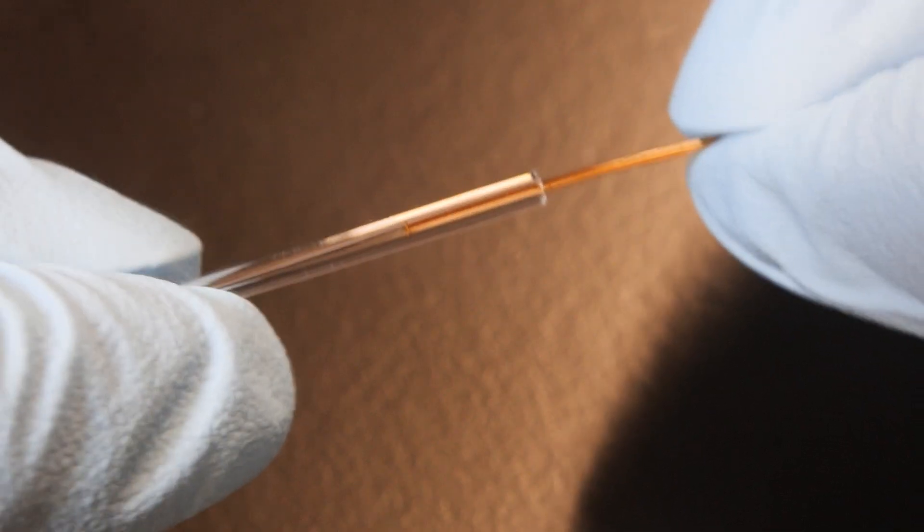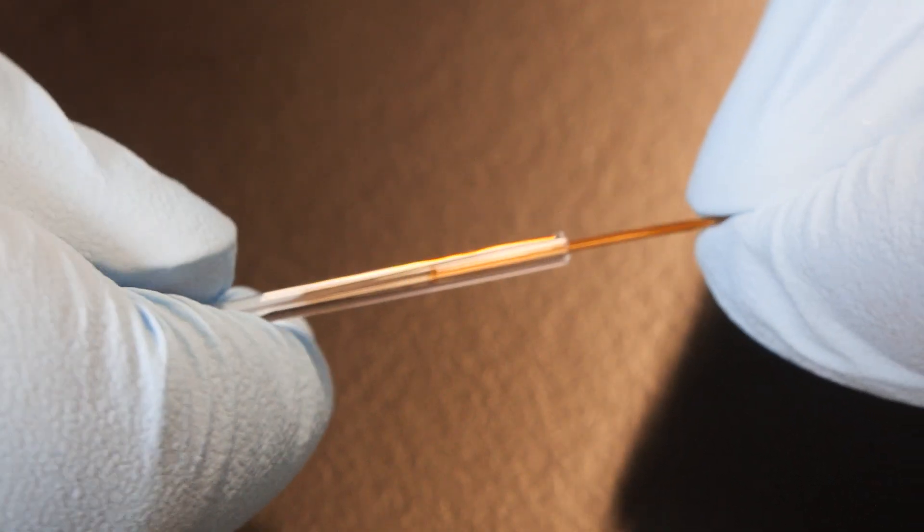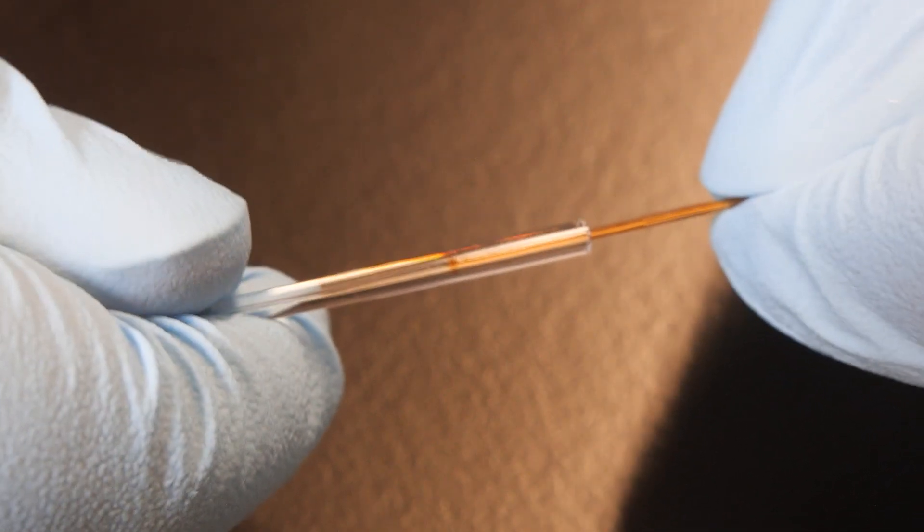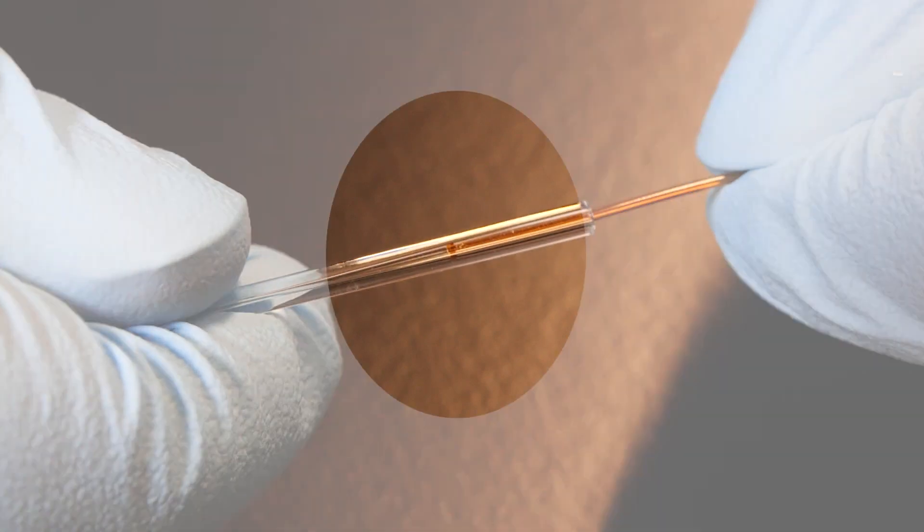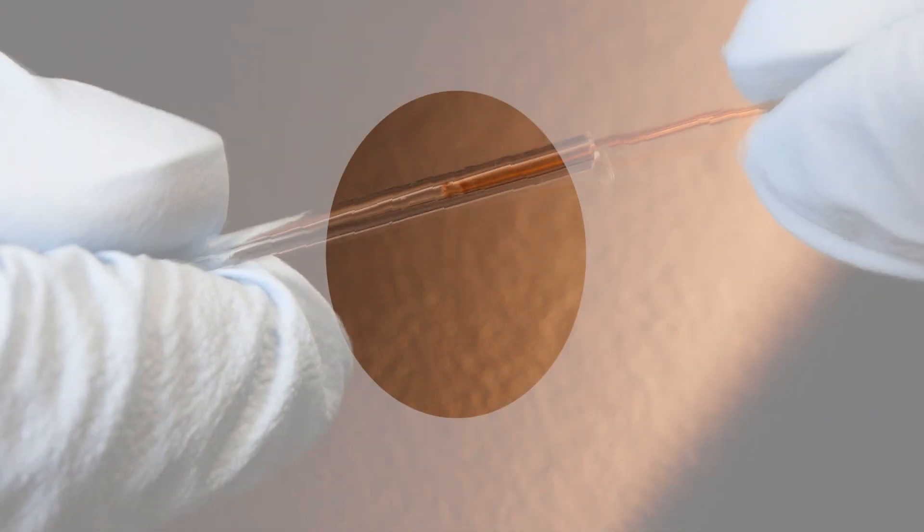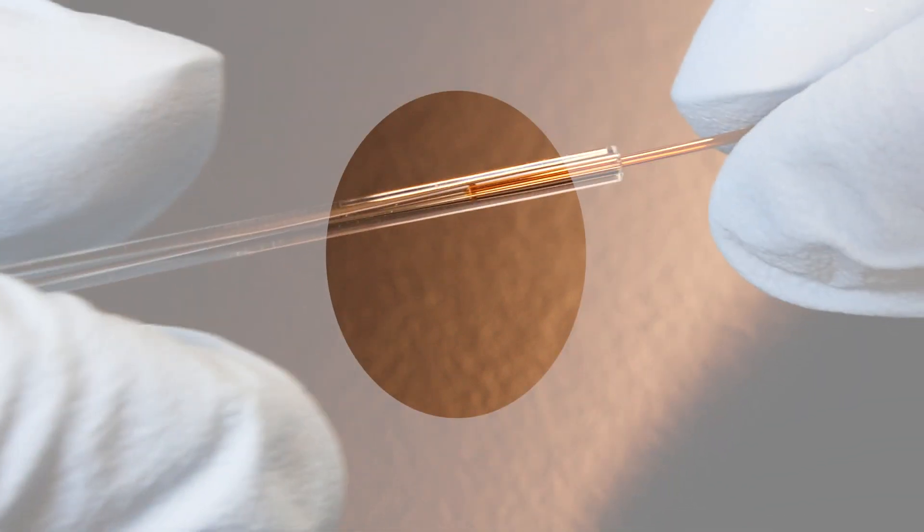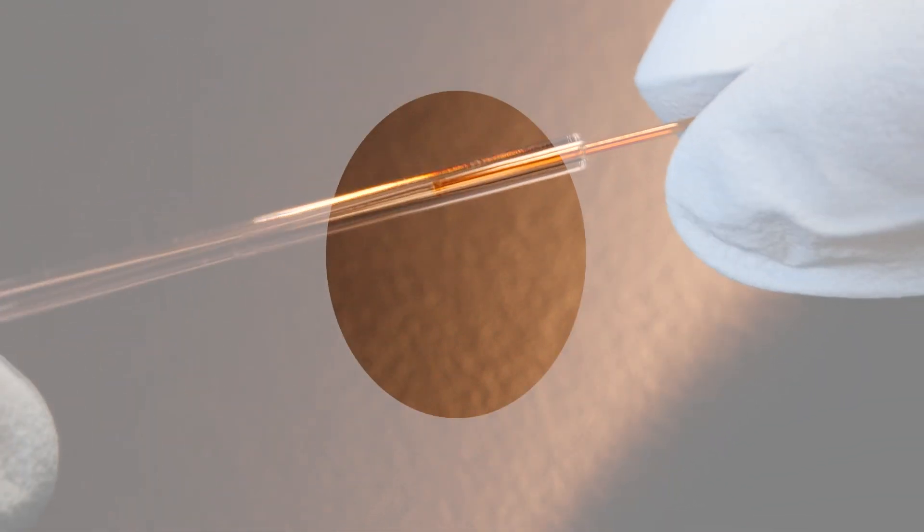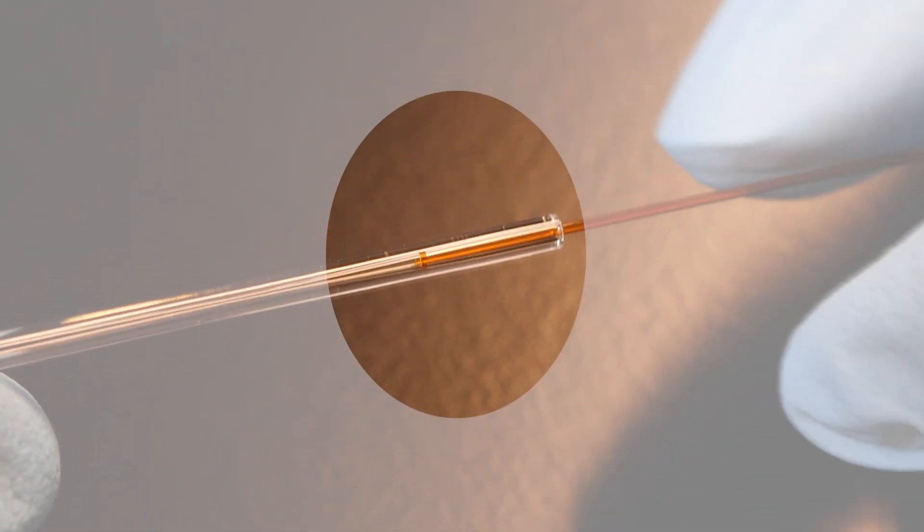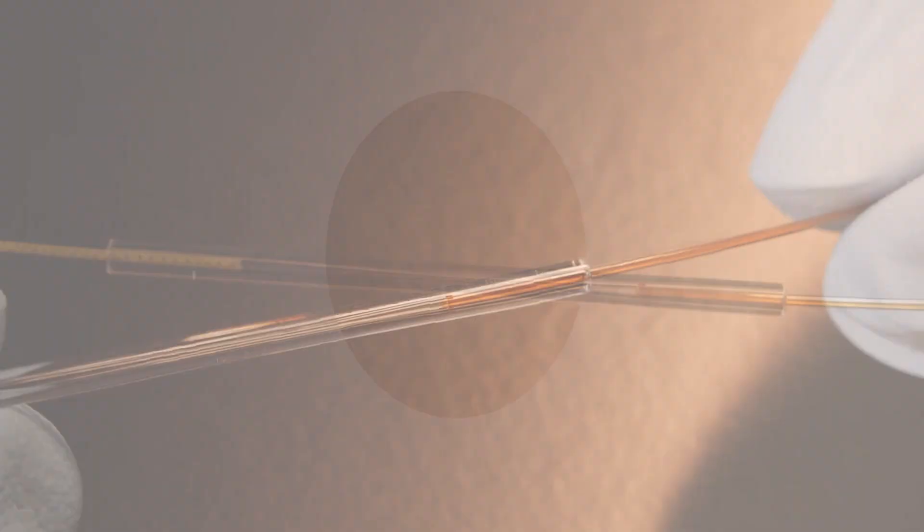And now, we'll simply repeat the process with the particle trap, gently inserting it into the other end of the connector. A continuous browned ring where the column end compresses inside the connector indicates a proper connection.